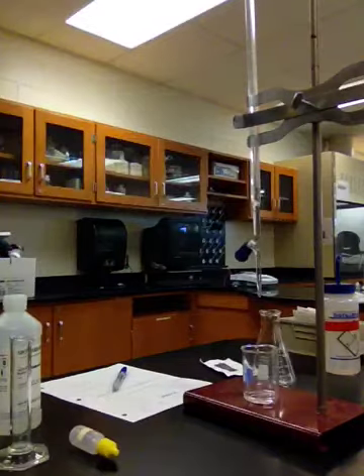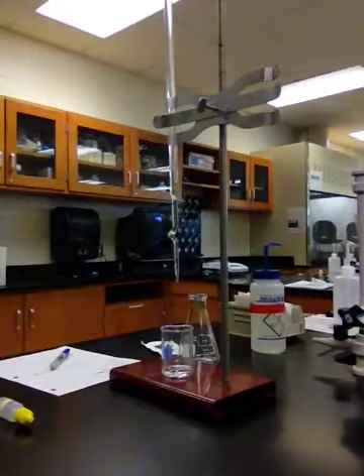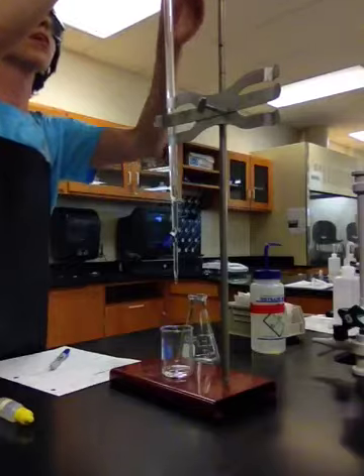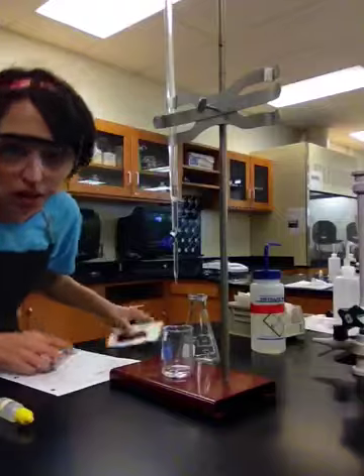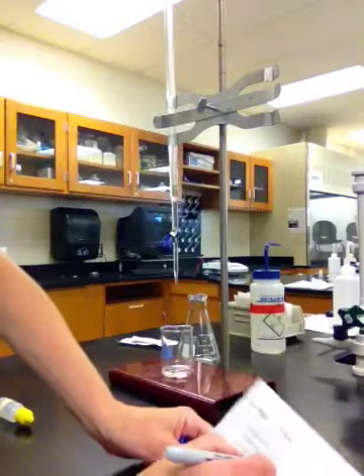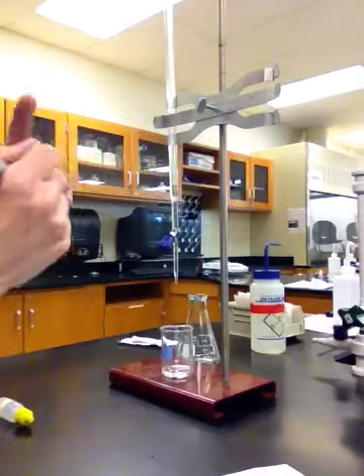Now something kind of cool that you can do, try to move this back so you guys can see. Sorry about that. Is that I have this piece of paper with black on the back, and it makes it a lot easier to read. Okay, so I'm up here reading it. It doesn't much matter, but if I get eye level, it's right around exactly 7.00 milliliters. So again, on your lab, it says initial burette reading. I want you guys to write 7.00 milliliters. Okay, with the burette, that's where our NaOH solution volume is starting.